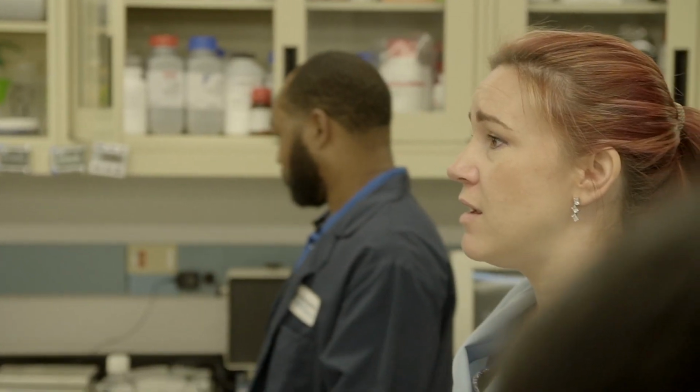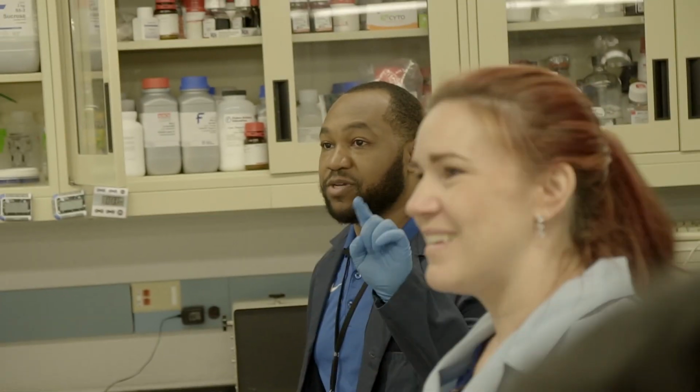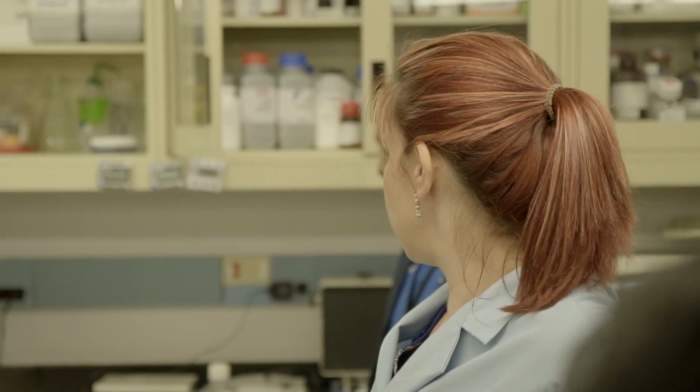So if we're doing 2% in 50 mils, how much agarose is going to be in each gel? And you might need to jot it down on a piece of paper. So 0.02 times 50 is what? What's 2 times 50? How many decimals were in 0.02? How many places? So move 2 decimal places. You had said the wrong units. Yeah, 1 gram. They're doing 1 gram in 50 mils to make their agarose.